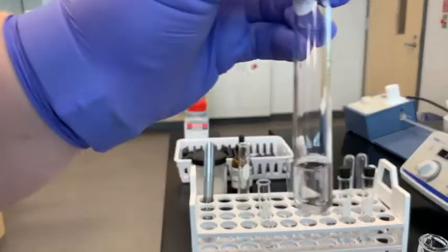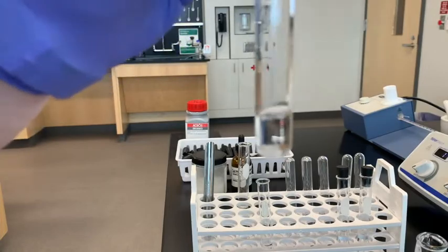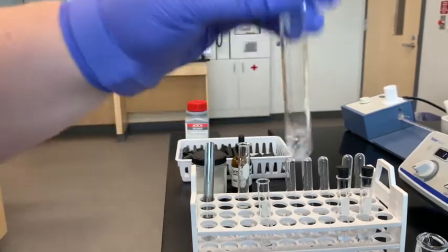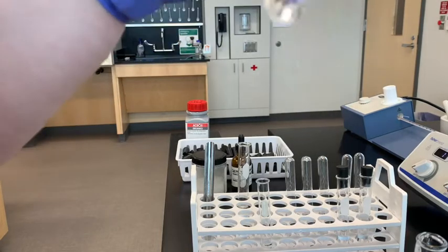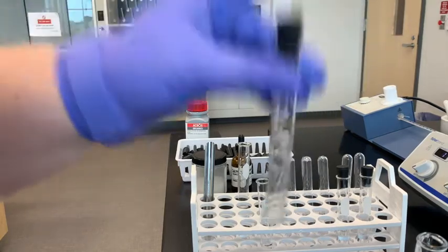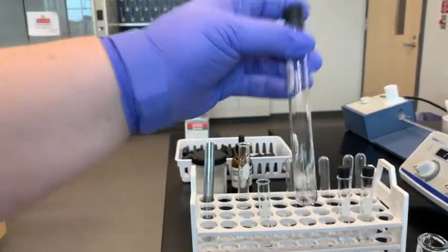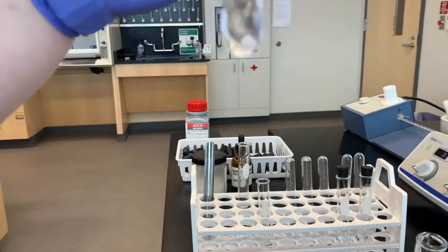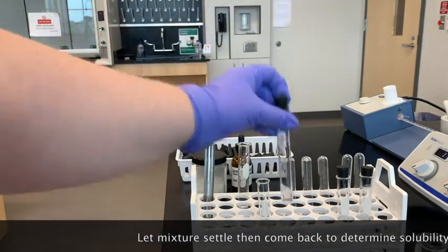Looking at it right now, you can see there's solid on the bottom. We want to see if those pieces of solid get smaller, stay exactly the same, or completely dissolve — that's what you're looking for in the observations for the solubility of the unknown solid. I'm going to shake that up. This is the ethanol and the unknown solid.